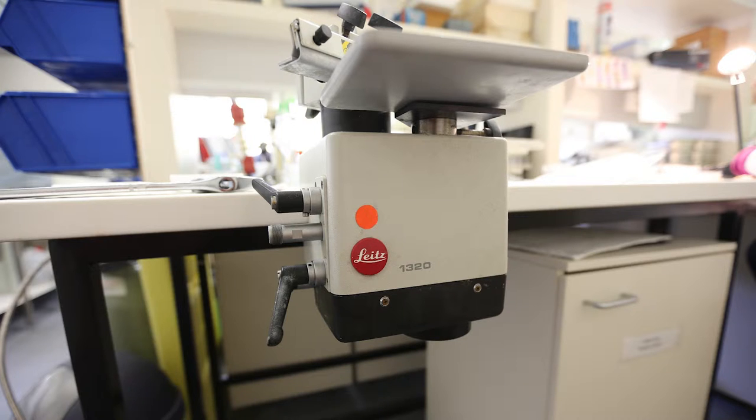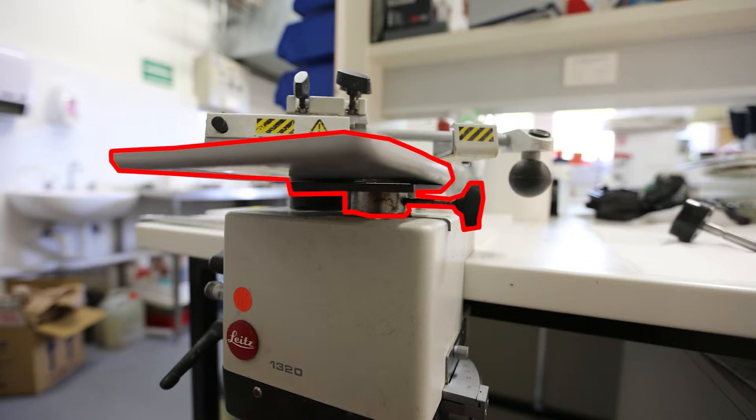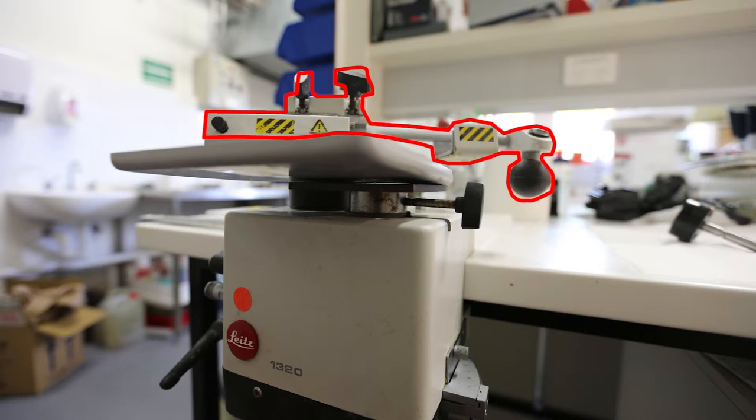Now, the problem is that the stage has been becoming stiffer and stiffer, so it doesn't increment upwards as easily as it used to, until finally the other day it stopped incrementing at all. Now the arm that the blade is attached to still works fine, so it still moves, and you can hear the ratchet operating, with one click being for every two microns of stage advancement, and that's still working fine.